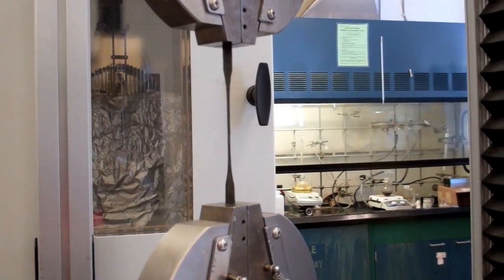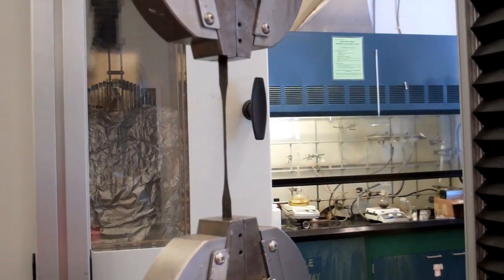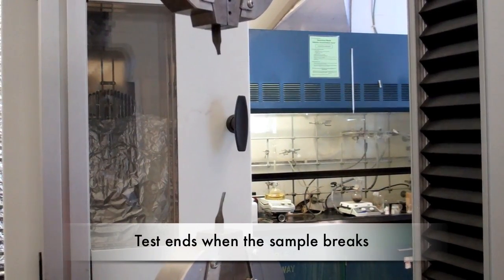Press the start button to begin the test. The sample will then begin to stretch, and the load applied and the extension of the sample will be displayed on the computer. The test will be completed once the sample breaks.